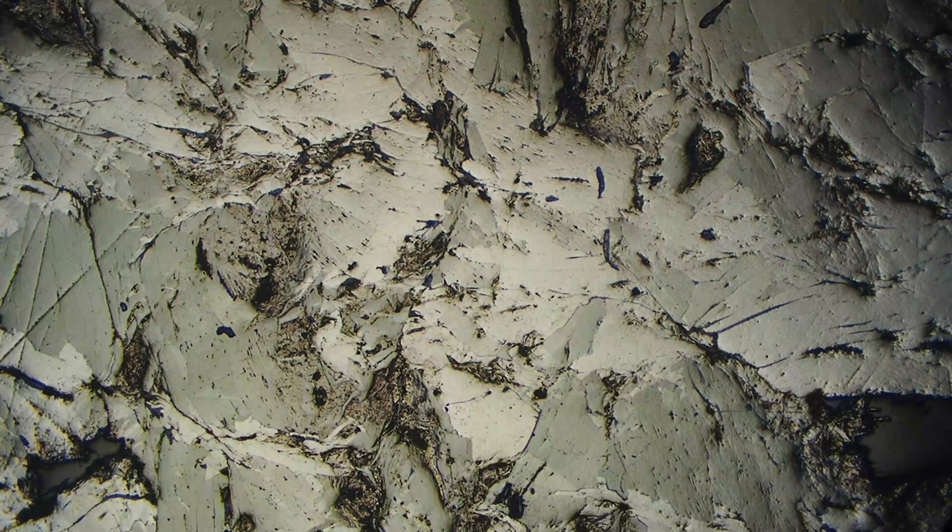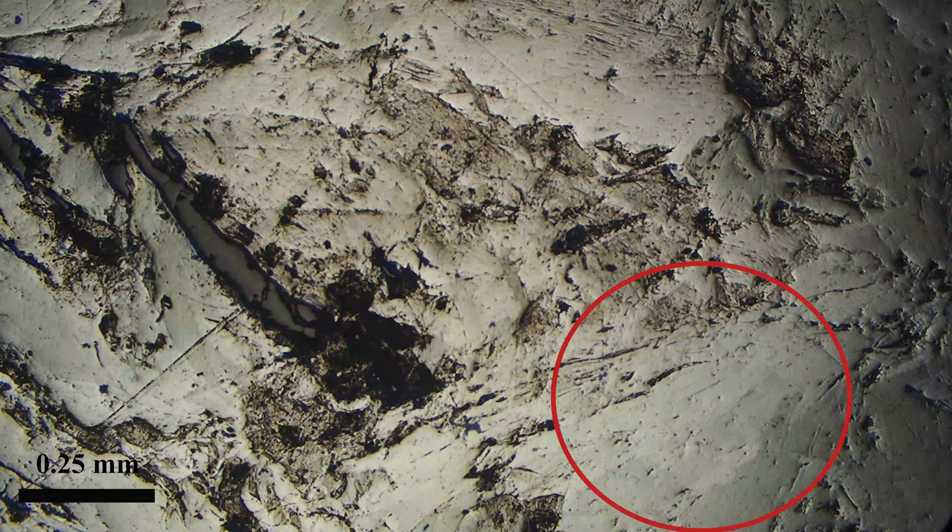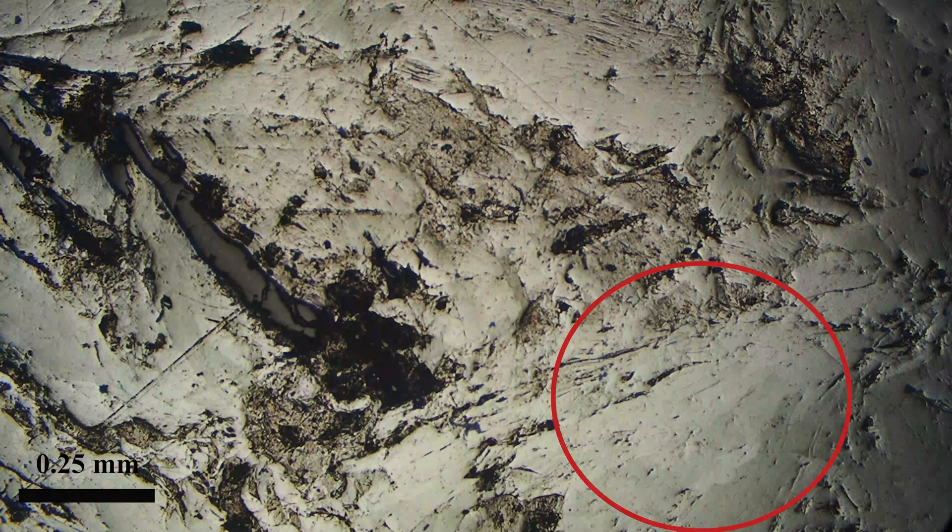The samples we're looking at today are mostly pure molybdenite so we don't see too much of that. Here we're on to another sample. Again we're going to rotate the stage, and you can see as it goes through that kind of greenish color through to white as we rotate the stage.